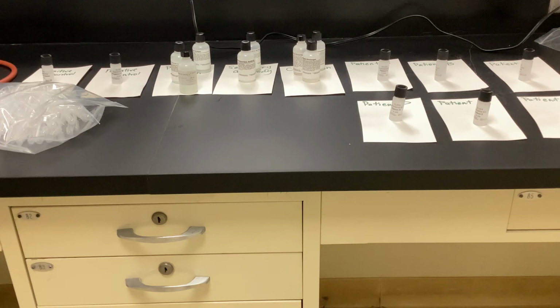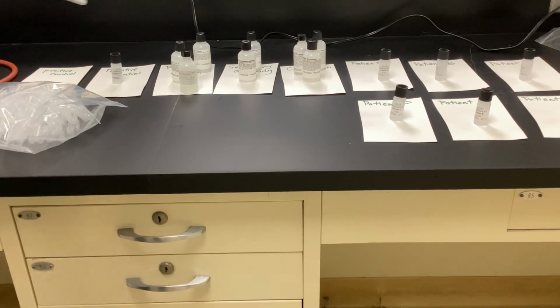So I'm going to take the antigen for Lyme's disease, and I'm going to put it in all of the wells. Then I'm going to take what's here, it says positive control. So I know that this is going to have the antibody in it. This will have the antibody in here. We're going to do 3 wells for each scenario just to triple check. Was it 1 or 2? You know, you might have a false positive. So we're going to do 3 for each. Then I have something called the negative control. So I know this shouldn't have a positive reaction.